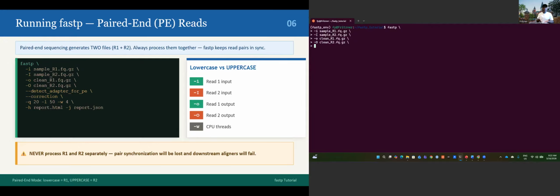Okay, now we can go to detect the adapter for paired end. If you want to add that, this is all from the help that I showed you before. Dash dash detect adapter for PE, it stands for paired end. And if you want the correction to be done, dash dash correction.